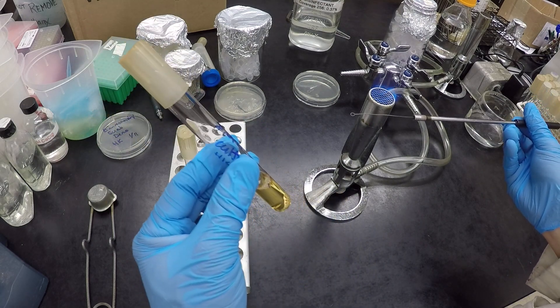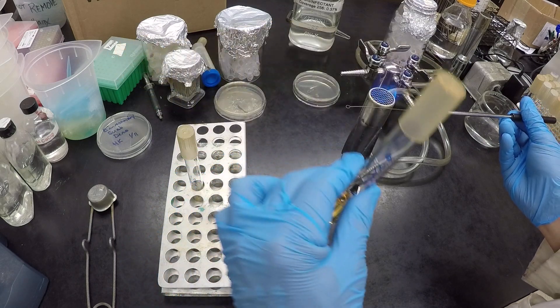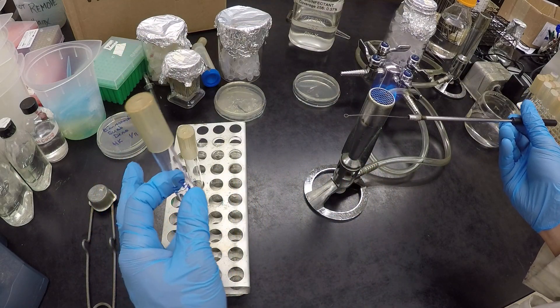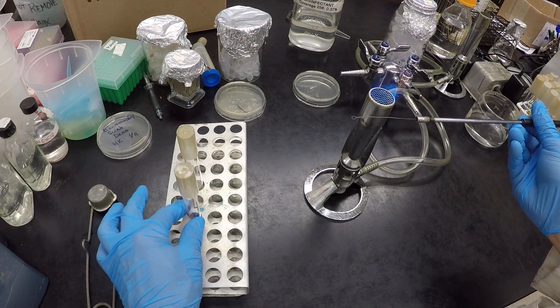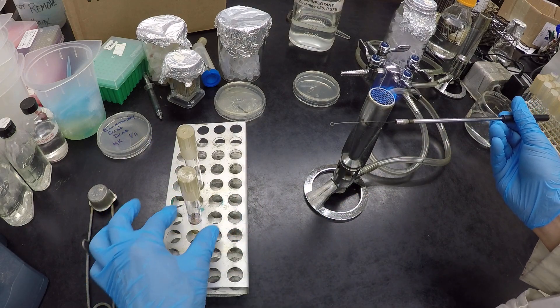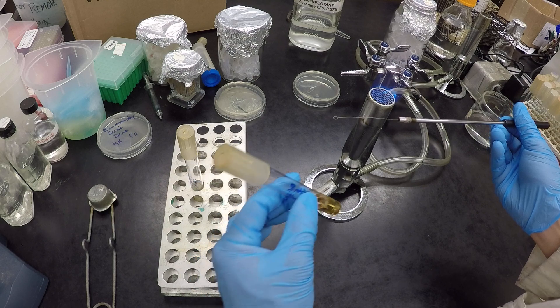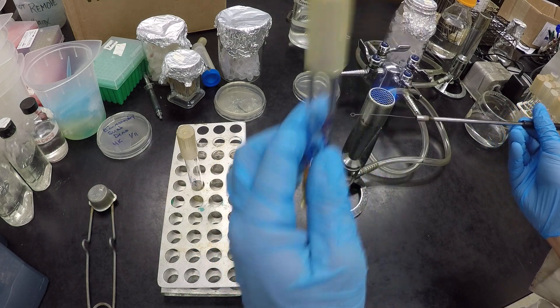So I'm going to take some of this broth culture and transfer or inoculate a sterile broth medium, which is going to be right there, which you can't see because I'm using the same one, just for demo purposes.